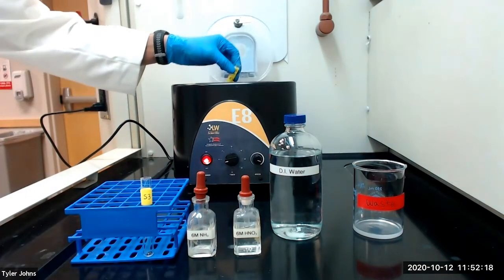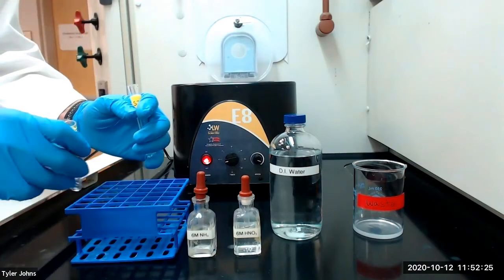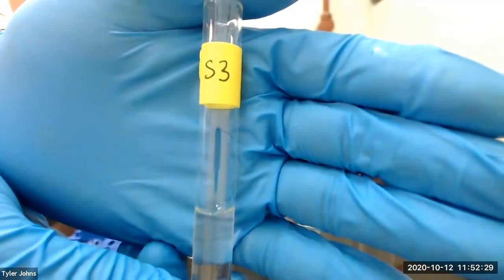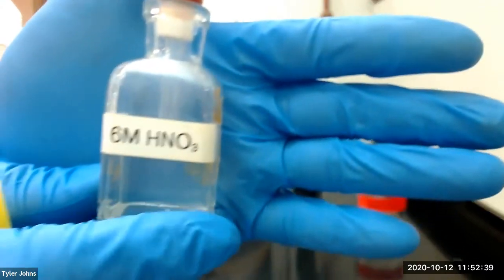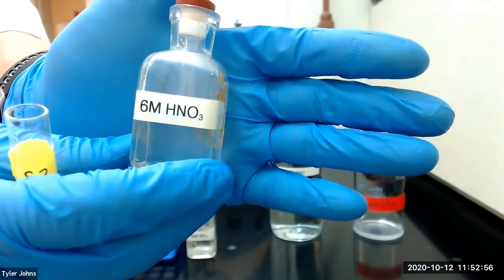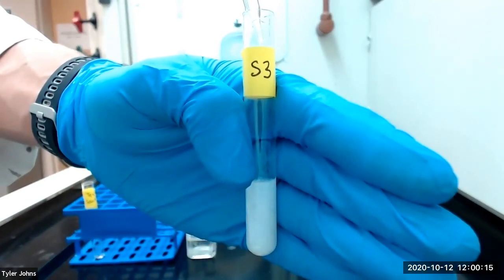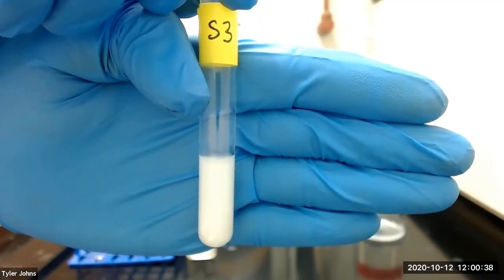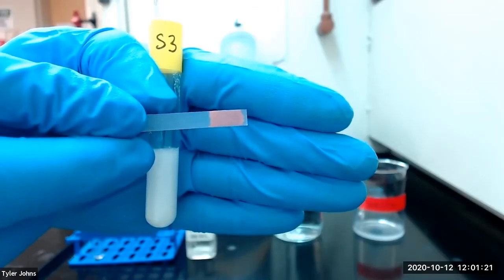After centrifugation has completed, we will transfer our solution to a new test tube labeled S3. We will then acidify our S3 solution with dropwise addition of 6-molar nitric acid until a blue piece of litmus paper turns red. The formation of a white precipitate confirms the presence of silver ion. You can see that our solution is now acidic as a blue piece of litmus paper has turned red.